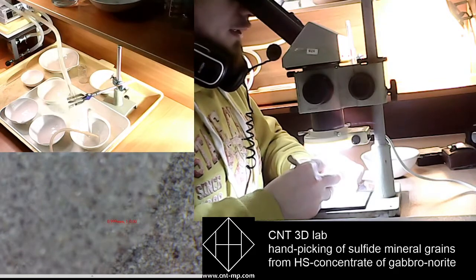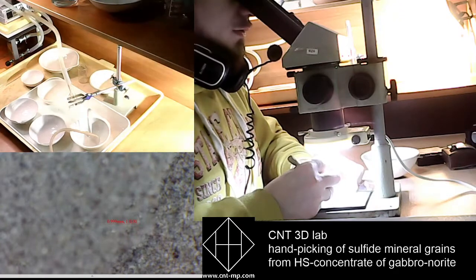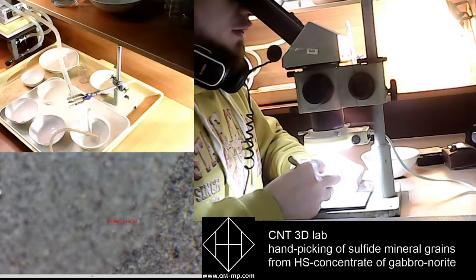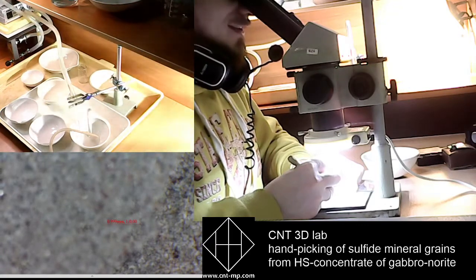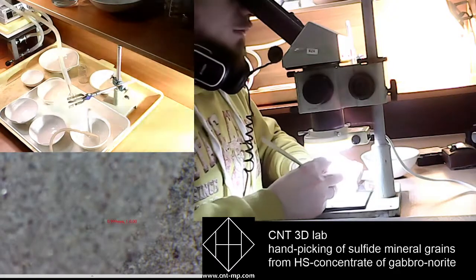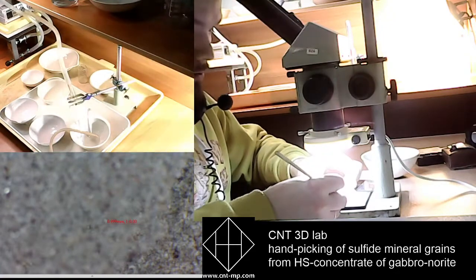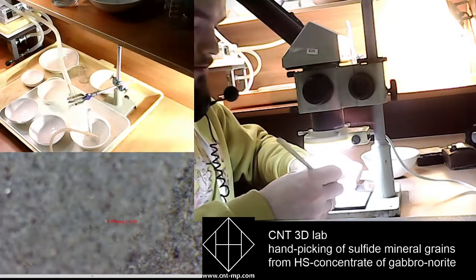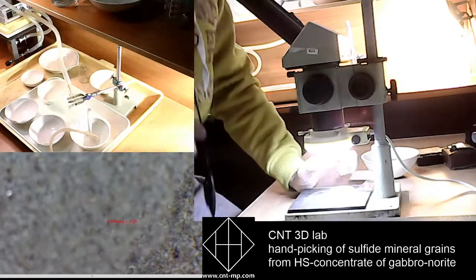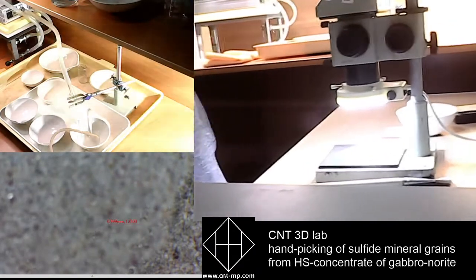There are a lot of really beautiful grains, with octahedric habitus. Oh, I have found a monomineral grain of chalcopyrite. Just place it there. I hope you can see. Oh, let me turn the camera a little closer.